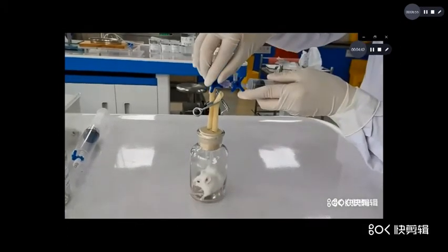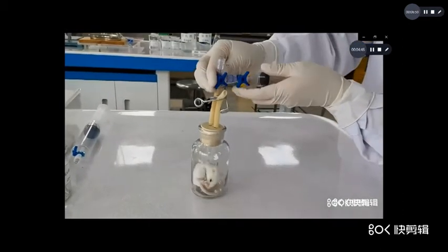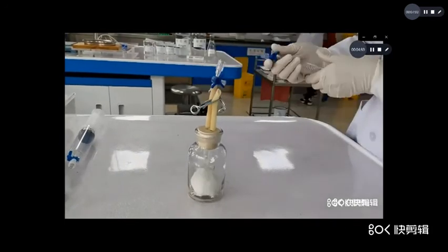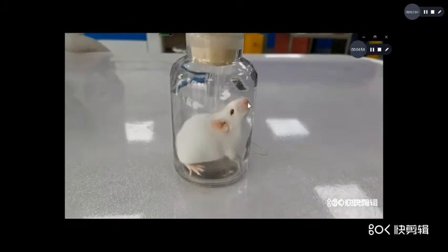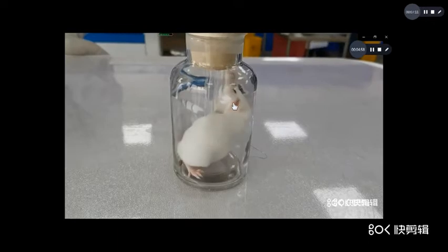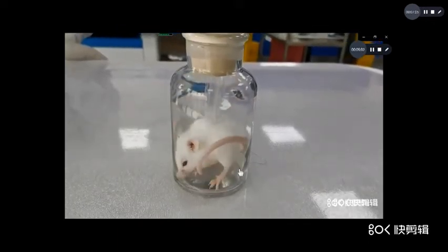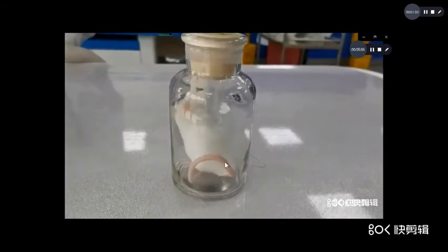Now close. Now you observe the manifestation of the carbon monoxide poisoning. Now you observe the color of the lip. What color do you think? Now, why did the color happen?